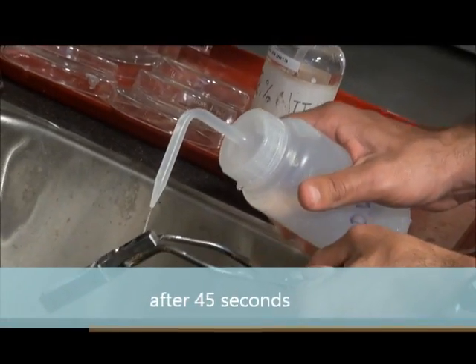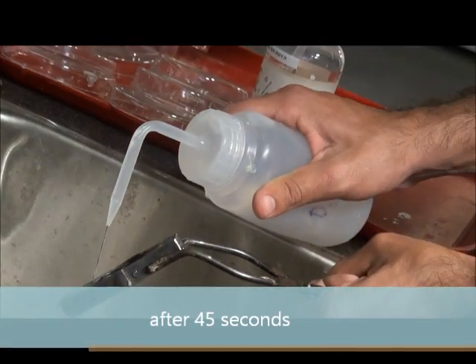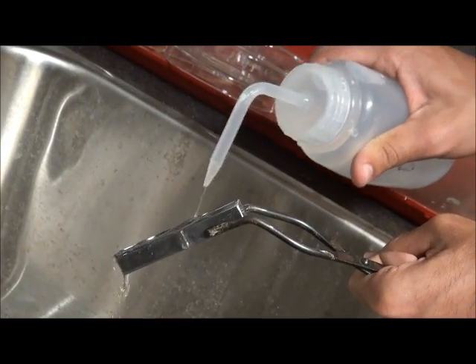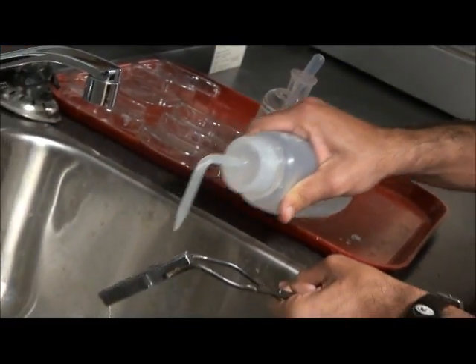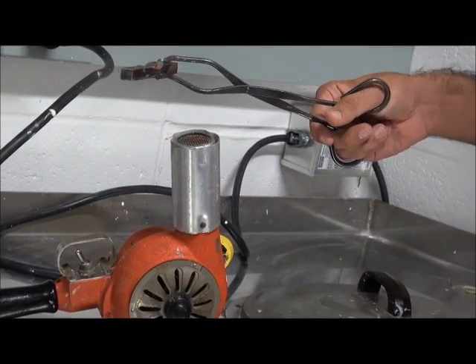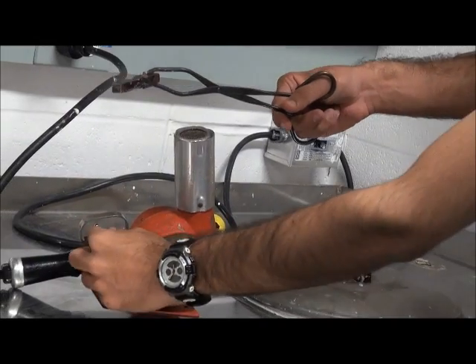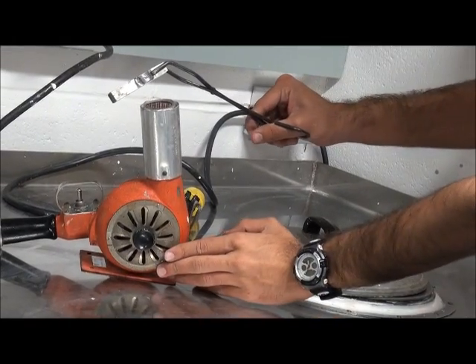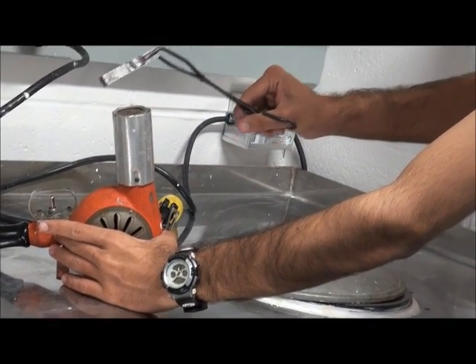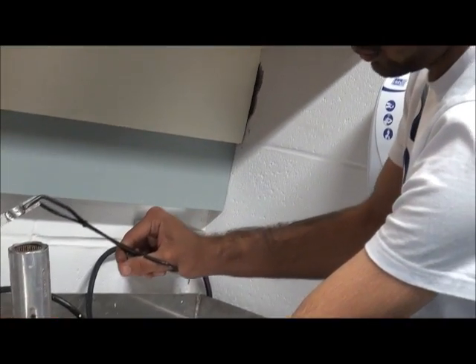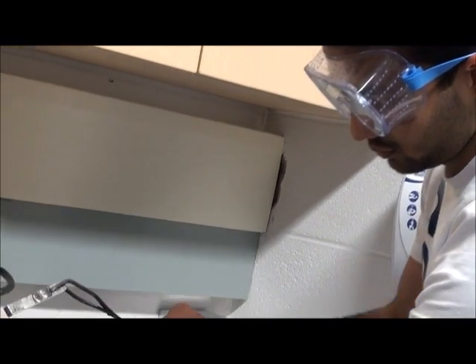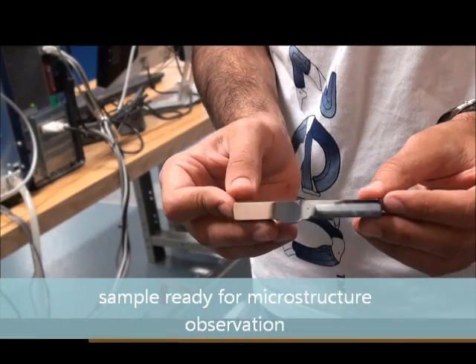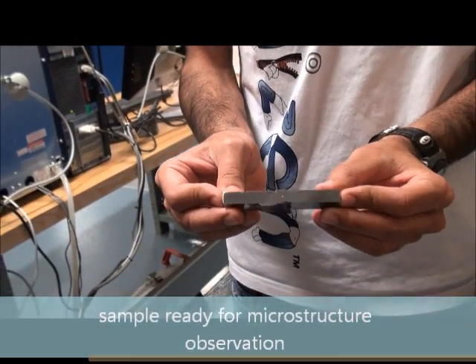After 45 seconds, we have to wash the sample with distilled water. After washing the sample with distilled water, we have to dry the sample. Now, as you can see, it is almost dry. Now, the sample is ready to examine under the microscope.